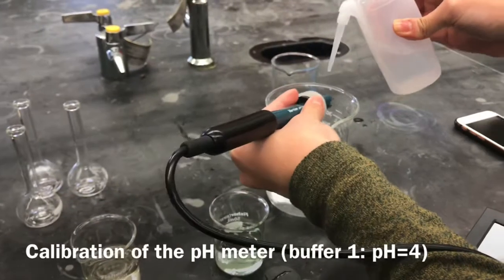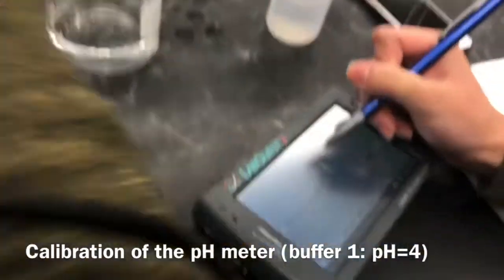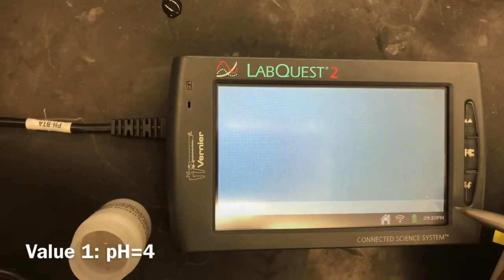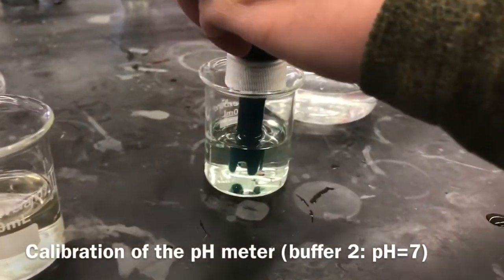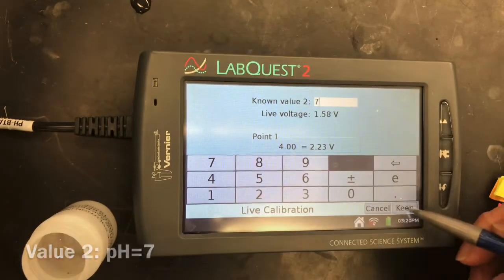Here we are calibrating the pH meter using a two-point method. First, we rinse the electrode with distilled water and place the electrode in one of the buffer solutions. We then wait for the voltage to steady out and then record that pH. We then rinse it again and move on to the next buffer. After you record that pH, your meter is now calibrated.